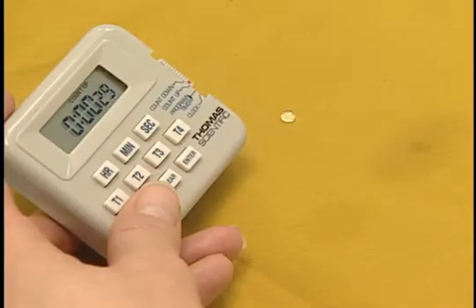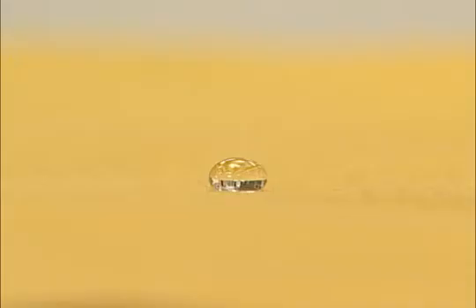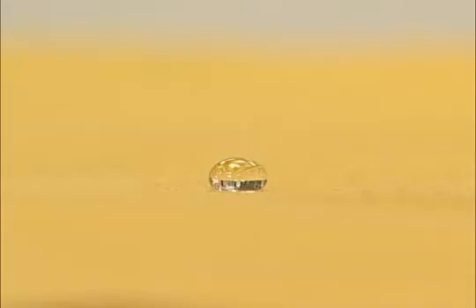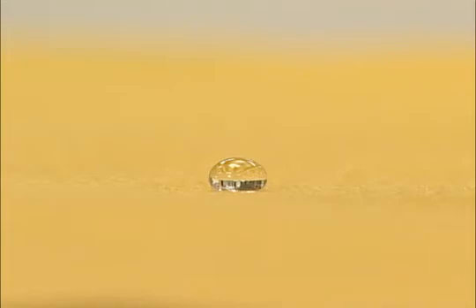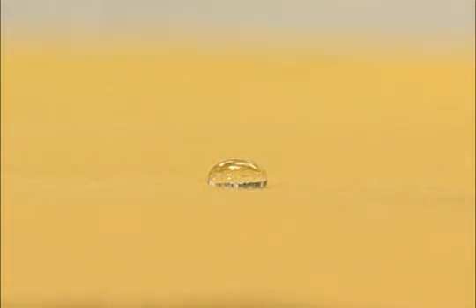After 30 seconds, the test liquid drops are observed to see whether the oil has wetted, penetrated, and wicked on the fabric surface. The visual scale shows drops that are still rounded, down to drops that have started to penetrate, and locations where the test liquid has fully penetrated the fabric surface.